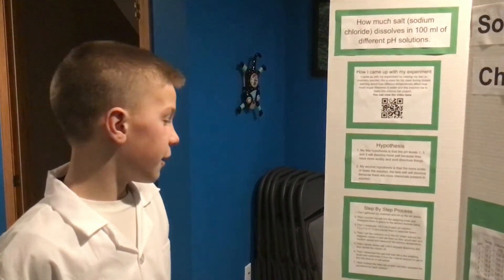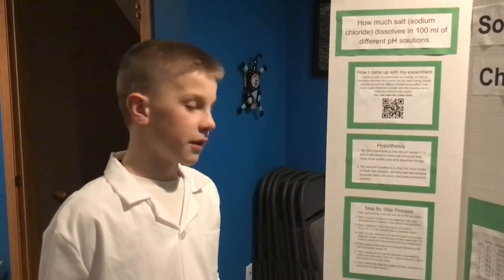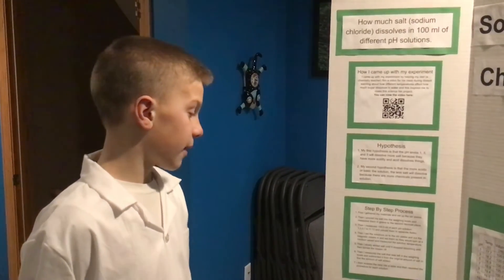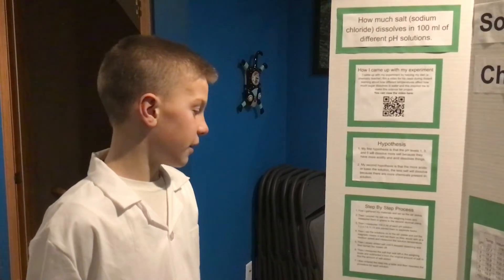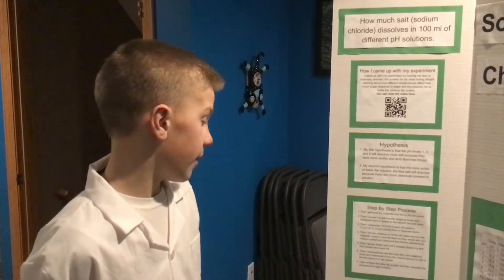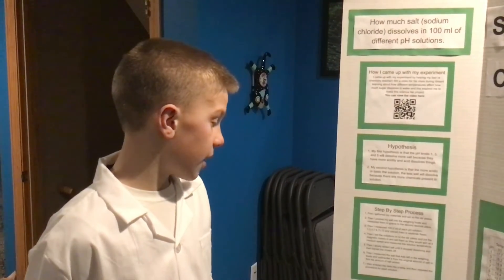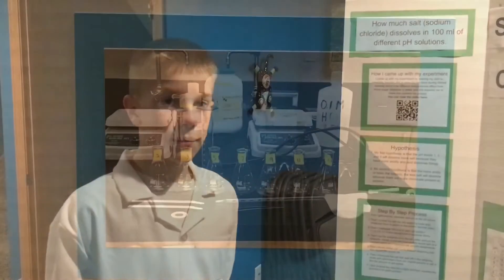Then I slowly added salt until it stopped dissolving and then turned the mixers off. Then I measured the salt that was left in the weigh-in boats and subtracted it from the original amount of salt to find the amount of salt added. Then I entered the data into a table and repeated the procedure for each solution.